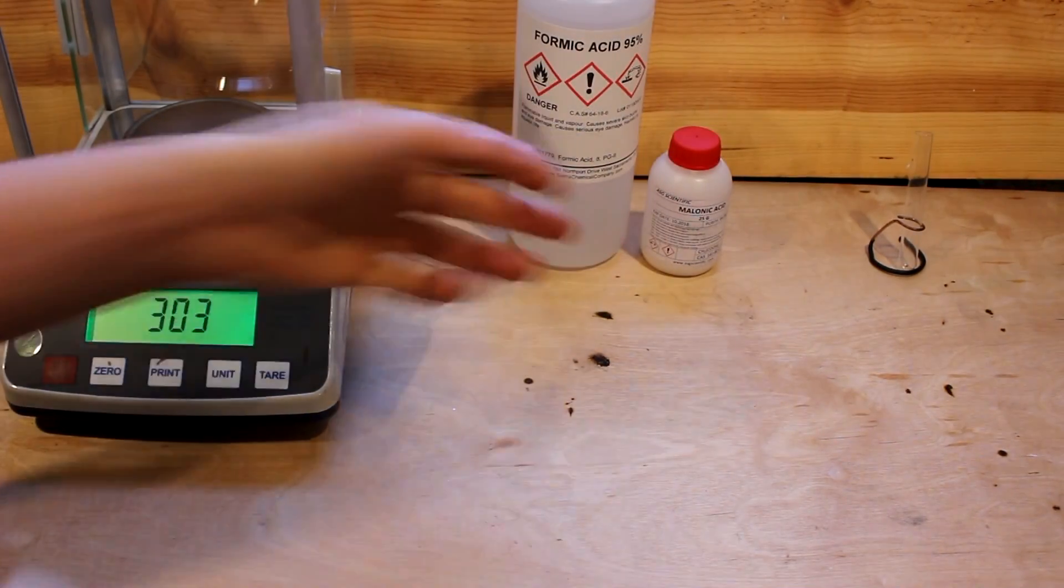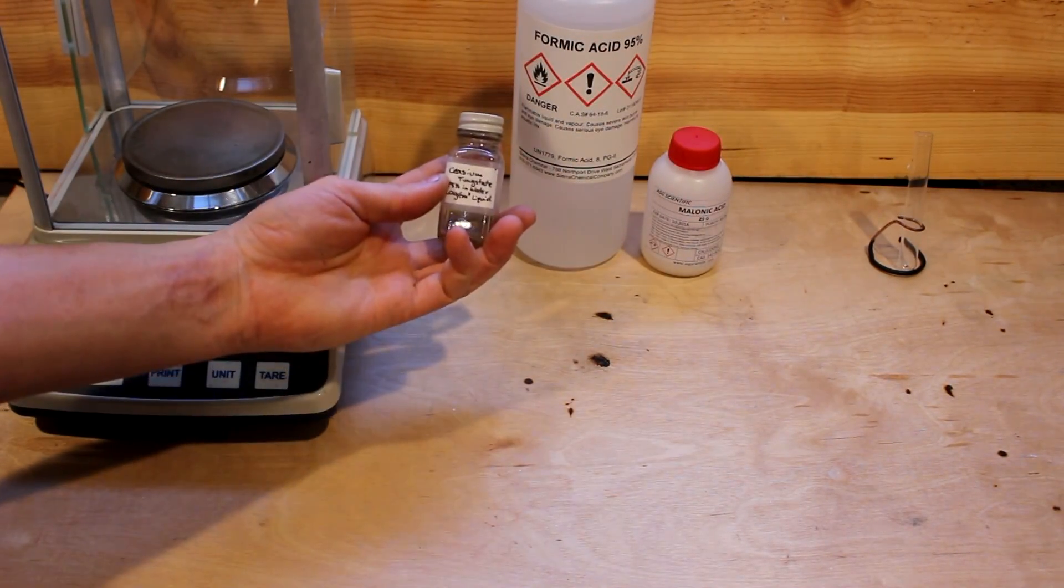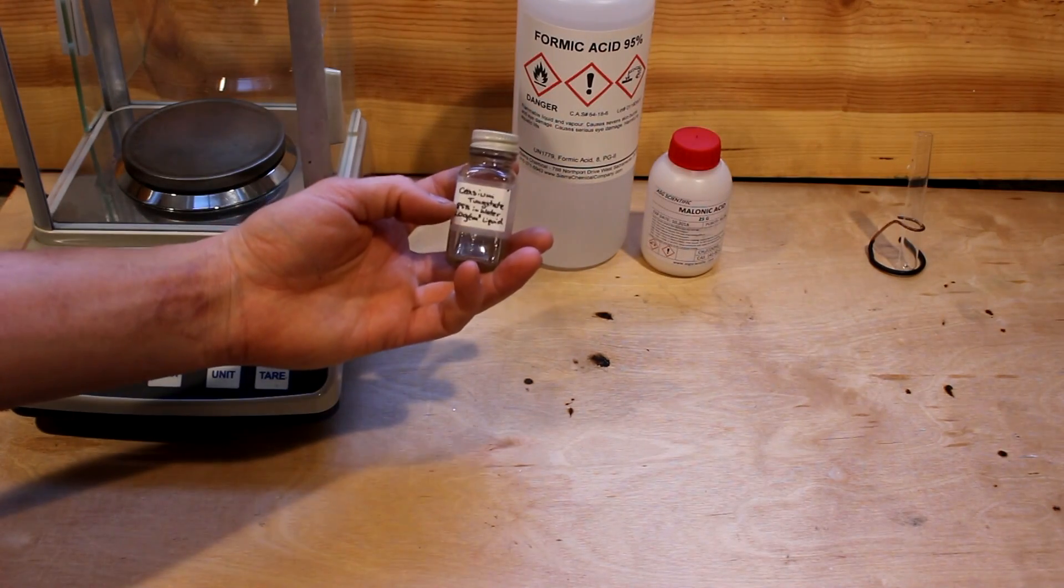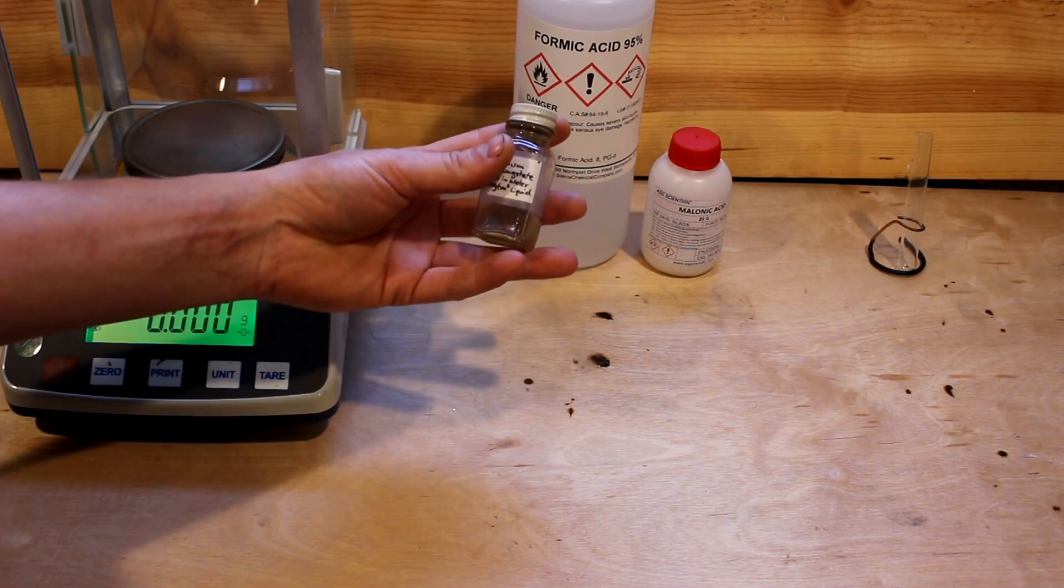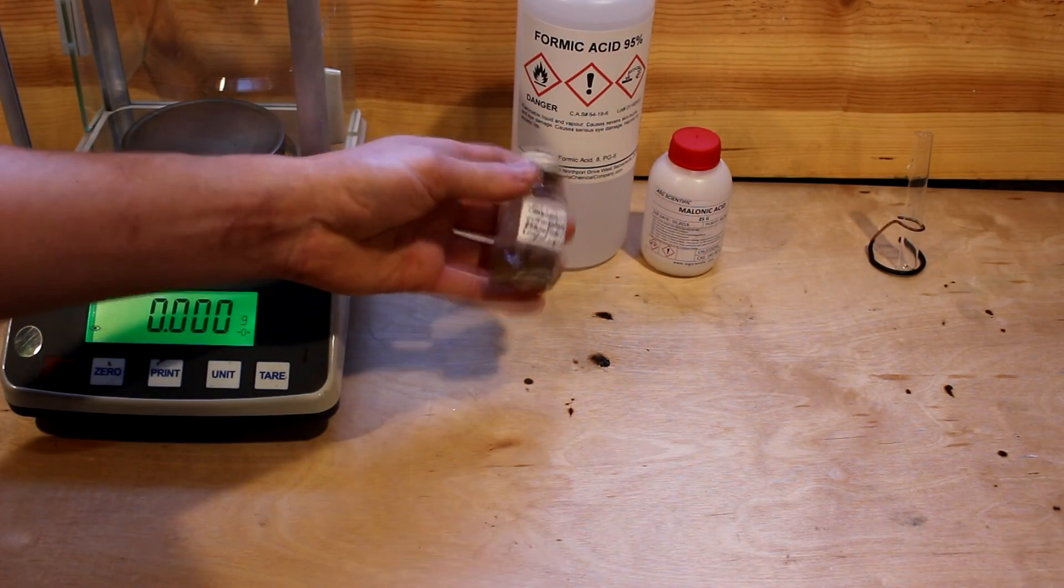All right everyone, welcome back to Cody's Lab. So a lot of you seem to enjoy my video on cesium tungstate, the salt that when dissolved in water makes a liquid that is dense enough that it can float rock. And so I think I will do a few more videos on the subject.